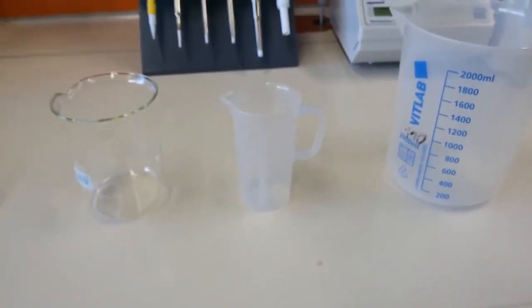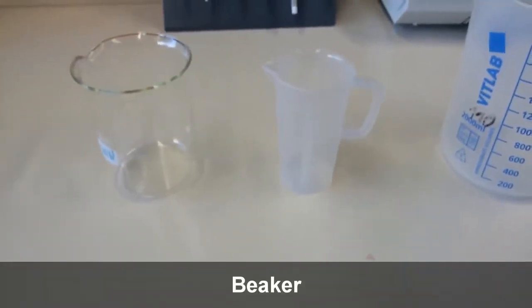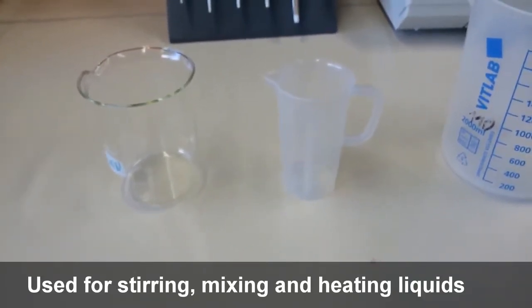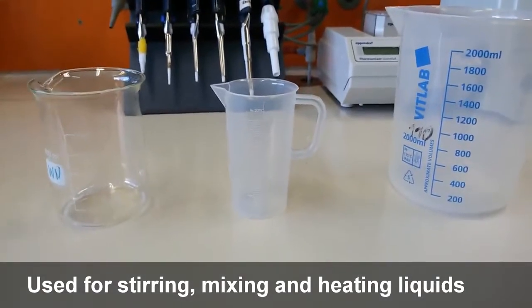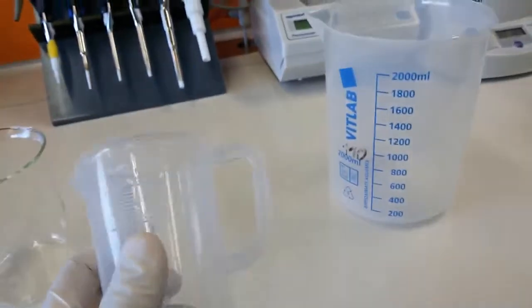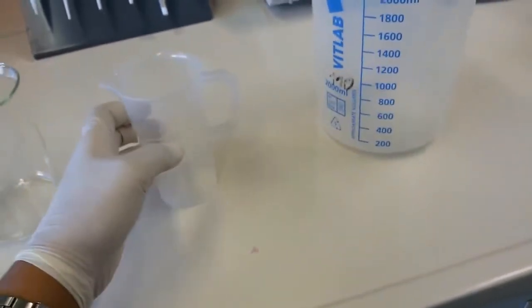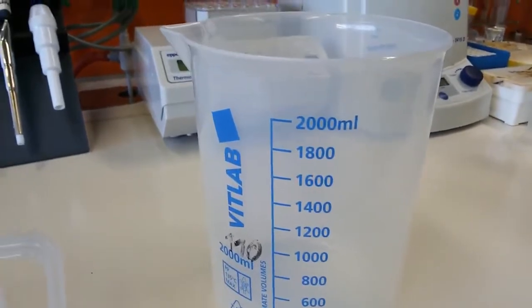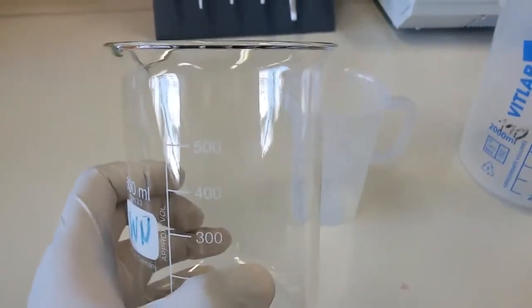I will now introduce you to another set of lab utilities. We call them beakers, and I hope you are already familiar with the term, because if any of you have attended chemistry classes, you have heard about beakers, right? Here you can see three types of beaker. They are of different volumes. Let's start with this one. This is a plastic beaker, and here you can see it's 250 ml. You can also use a beaker to measure volume. This one is 2000 ml, that's 2 liter, and this one is 500 ml.